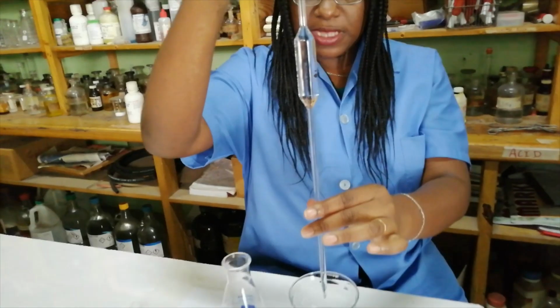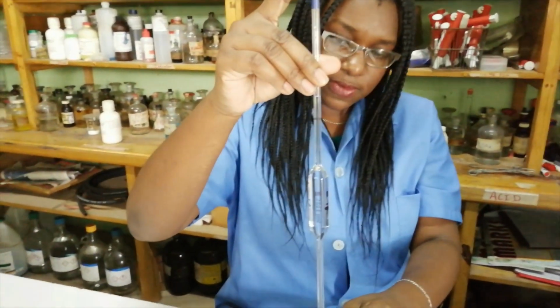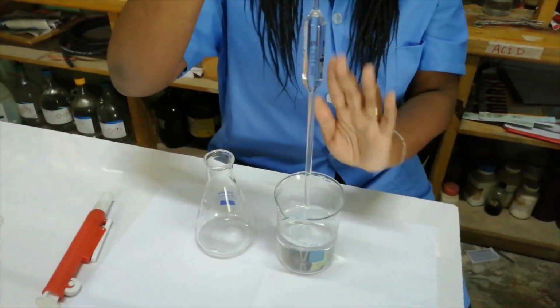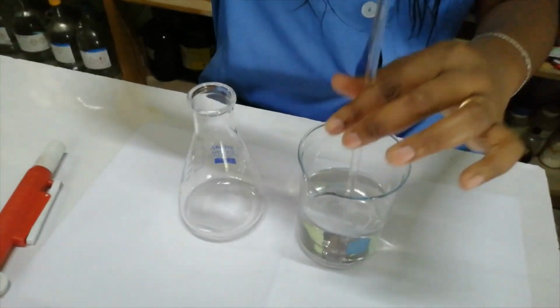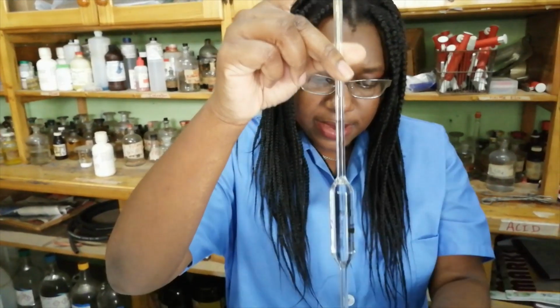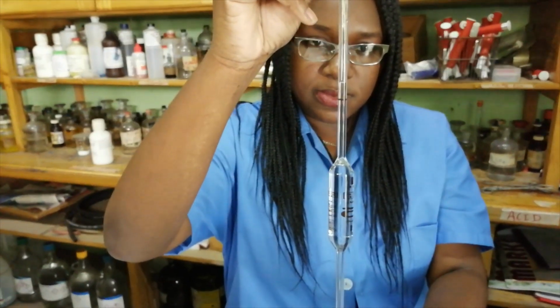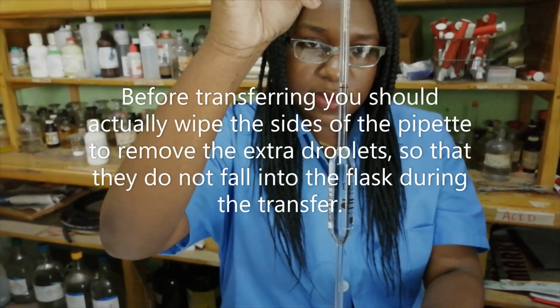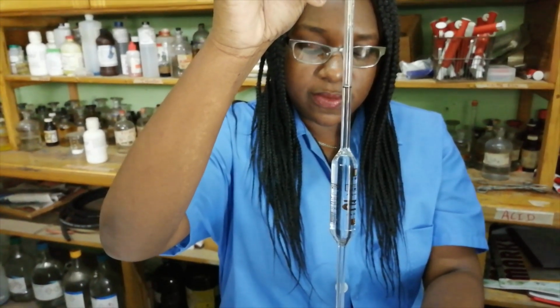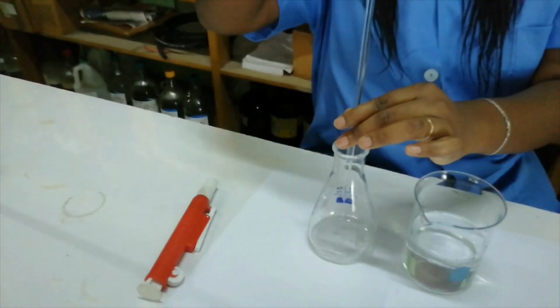Alright, so you have to take the pipette out of the liquid because if it's submerged in that liquid, what happens is that the fluid level will actually rise. So when you're reading it, you'll be on the meniscus, and if you take it out, that meniscus will be now below that line. And of course, you read at eye level. Not below, not above, but at eye level. So now the meniscus is on the line and we're transferring.